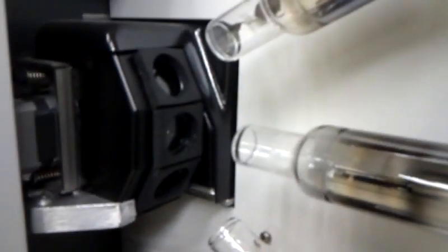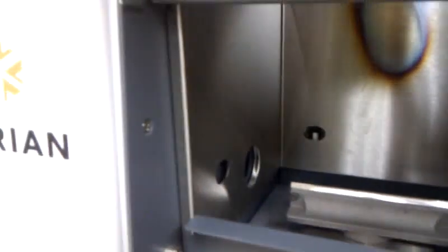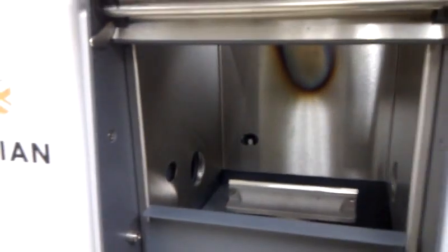If you look, you can see that the lamps are directed to shine their beam of light directly over the burner where the flame will be. You can see that the light is coming through. And then on this side over here is the detector.